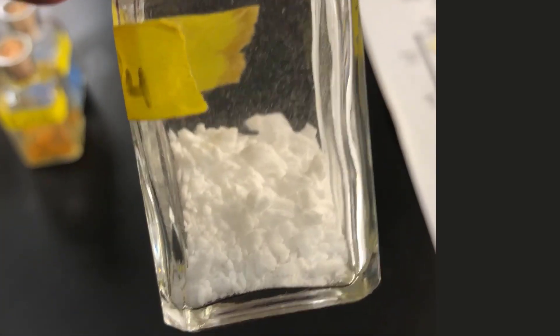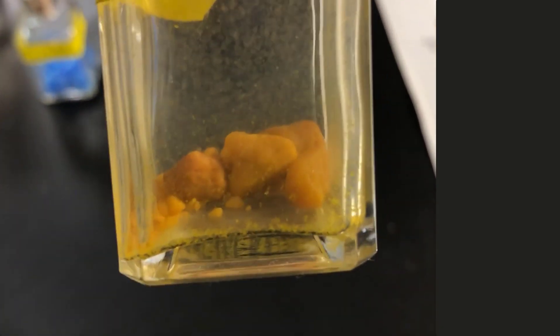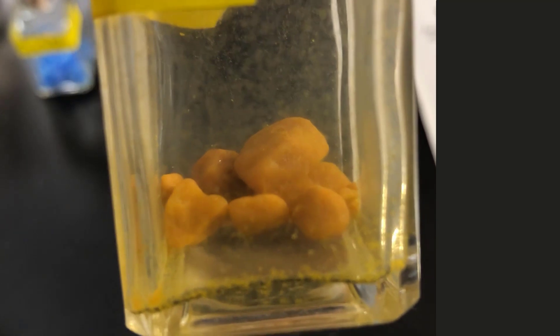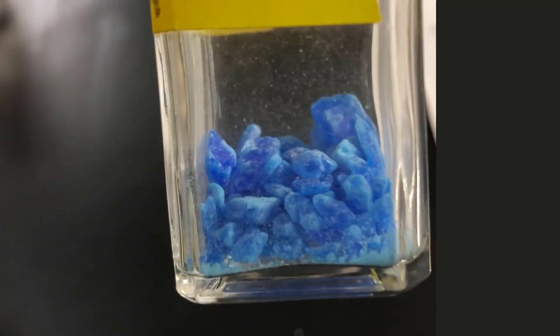This is MgSO4. This is FeCl3, you can see it's kind of chunky. And this beautiful blue stuff is CuSO4, also kind of chunky.